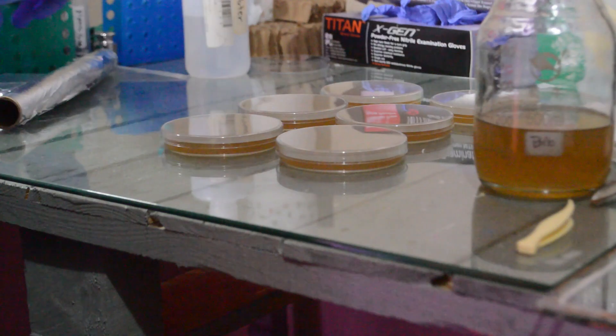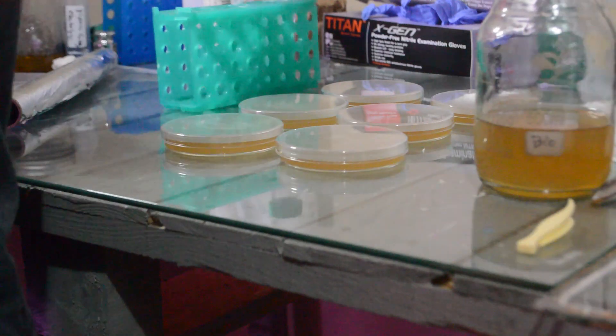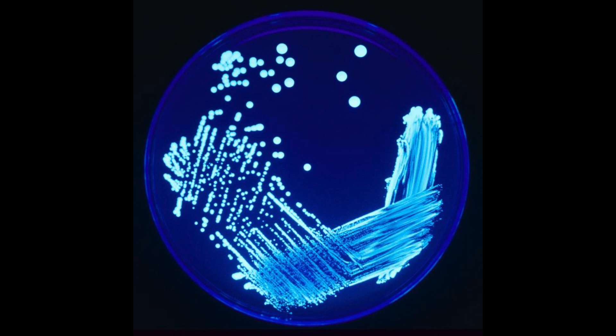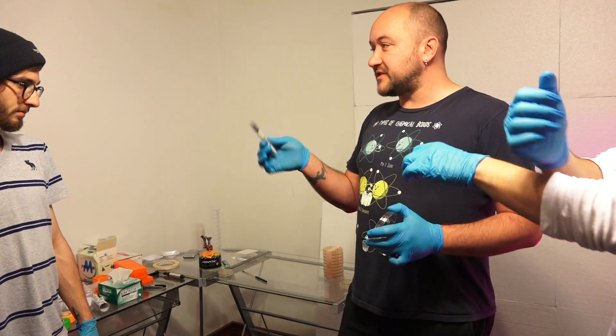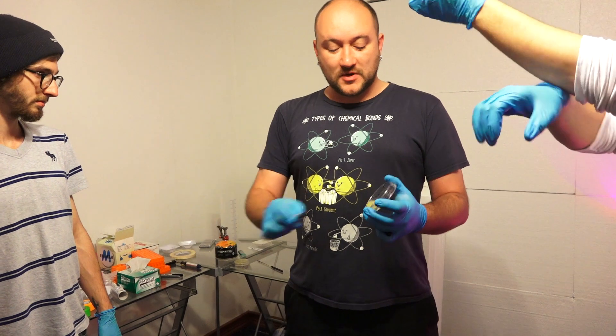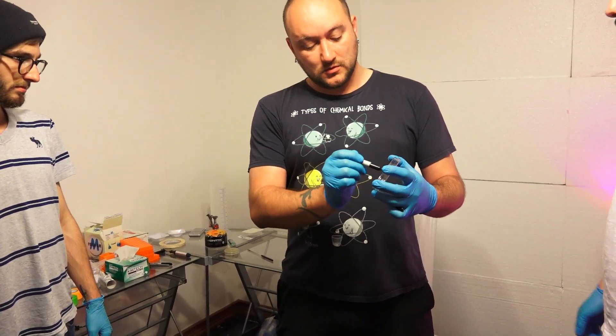Now that we've got our plates, what can we do with them? One of the main techniques in microbiology is called streaking. This process allows us to isolate single microorganisms — when you streak a plate you're essentially diluting a little bit of starter culture until single organisms are left, which grow into individual colonies made of genetically identical cells. If you want to learn how to streak a plate and culture microbes, head over to the SciHouse channel and check out the new video we just put together — my friend Gabriel Lucina gives a great talk that covers the whole process.